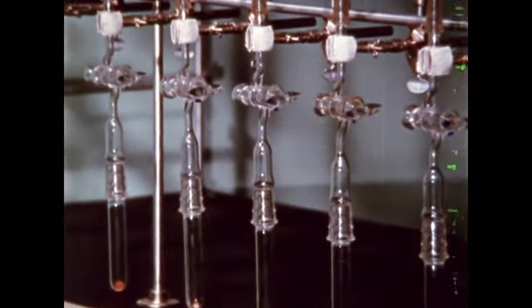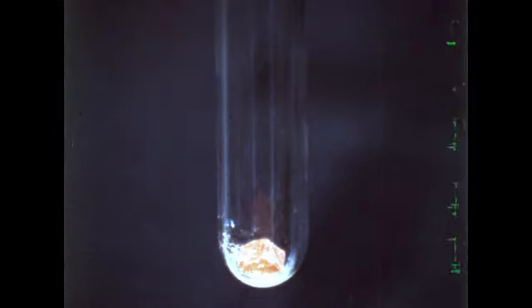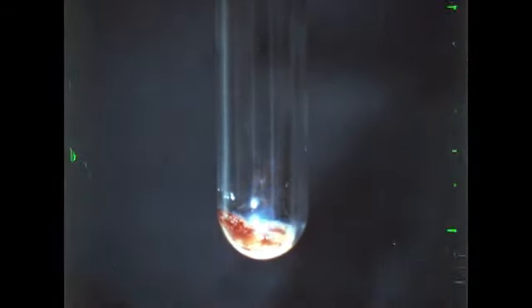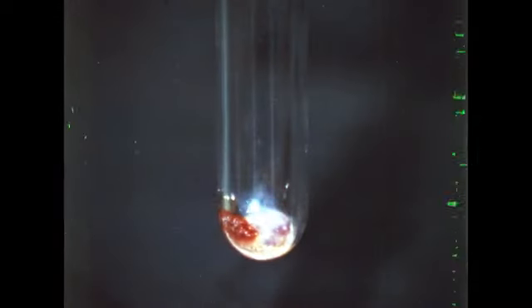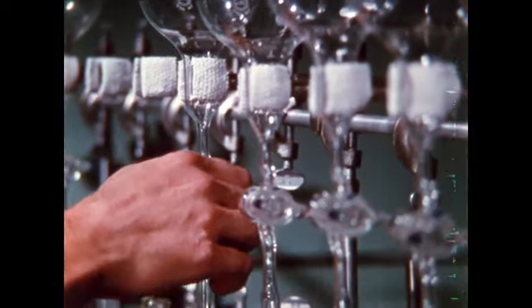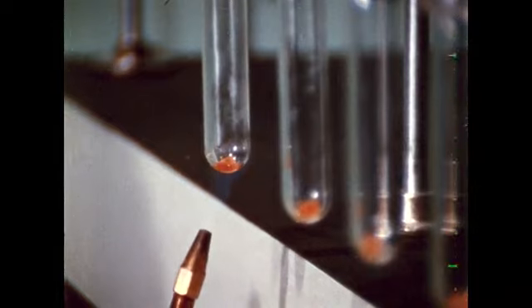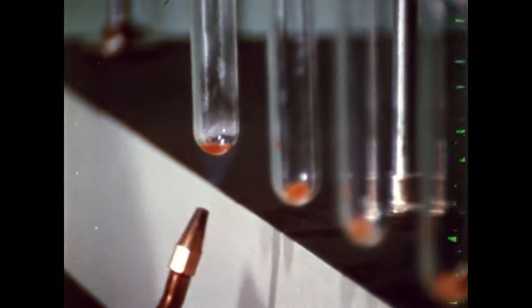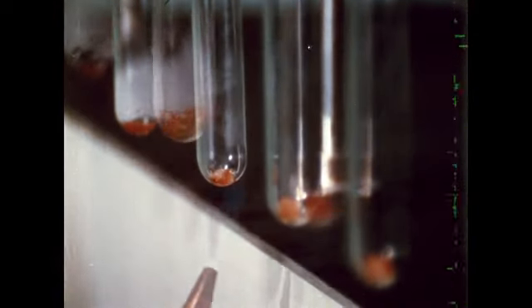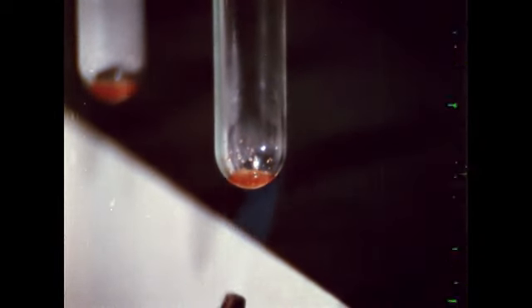Pieces of phosphorus have been placed in the tubes and we're ready to try the reactions. Fluorine will be tried first just for comparison. As soon as it strikes the solid phosphorus, reaction begins. Fluorine is not inert. We now let the inert gases into the 5 reaction tubes containing the phosphorus. The phosphorus is heated until it actually boils. What you see is not a chemical reaction, it is condensing phosphorus. Again, the 5 gases, argon, helium, krypton, neon, and xenon, are inert.